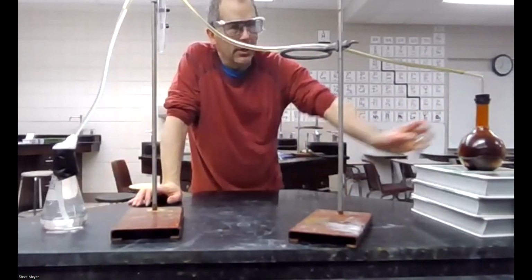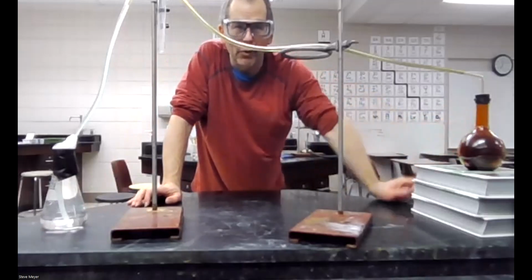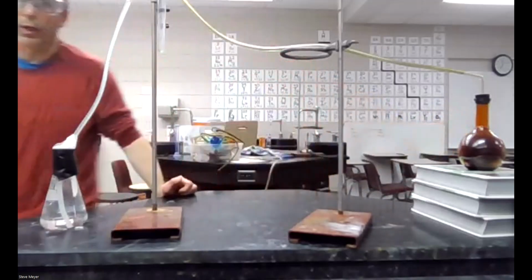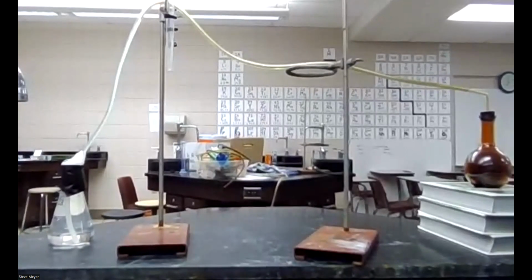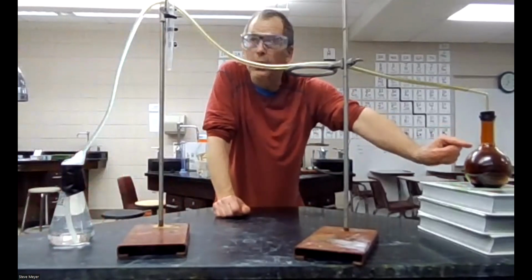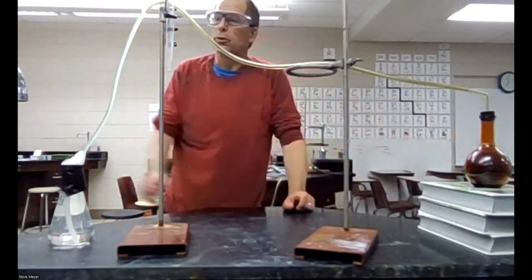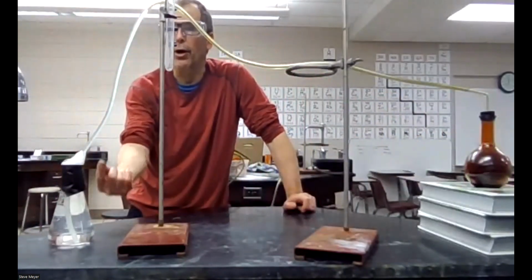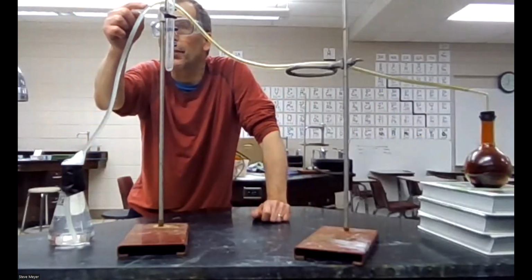Now you can't see this, but water is climbing up here, and what happened is after the reaction was done, the temperature of this got hot initially, but then it started to cool down after it was done. And as it cooled down, the molecules moved more slowly. And as they moved more slowly, they struck the sides of the container with less force and less often, and it created a lower pressure system here. So the pressure of air in the room is pushing down on this water, pushing it up. I don't think you can see this, but the water level's right up here.